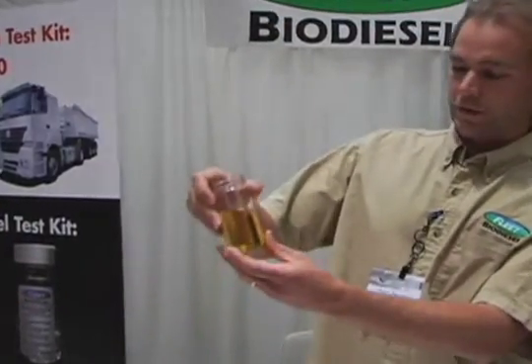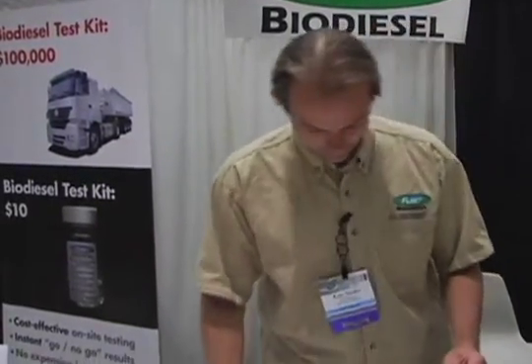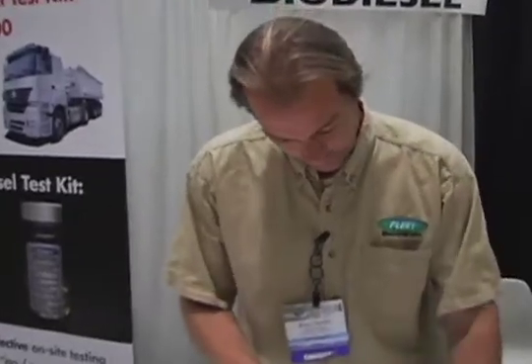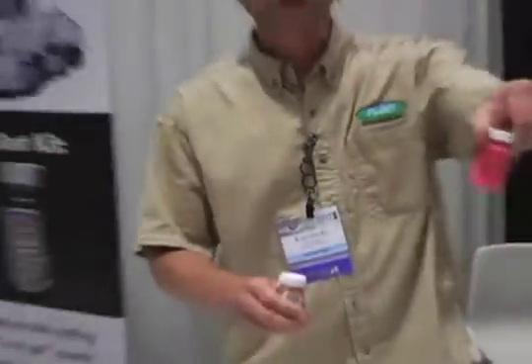This fuel, as you can see, is clear and bright — it smells good, it looks good, you'd never know that there was a problem with this fuel. All the user does is fill up their little test with this and shake it up, and if the fuel is good it stays pink, like the color of this one.